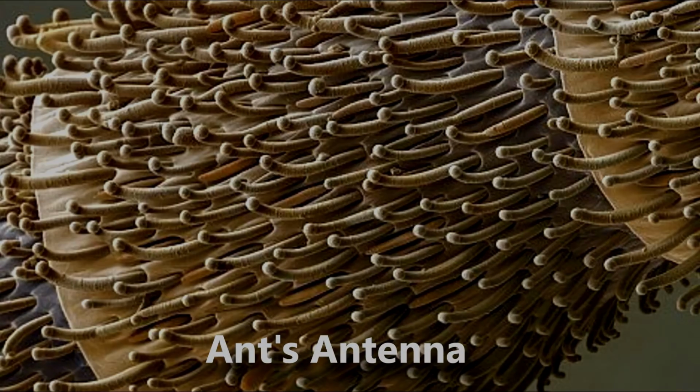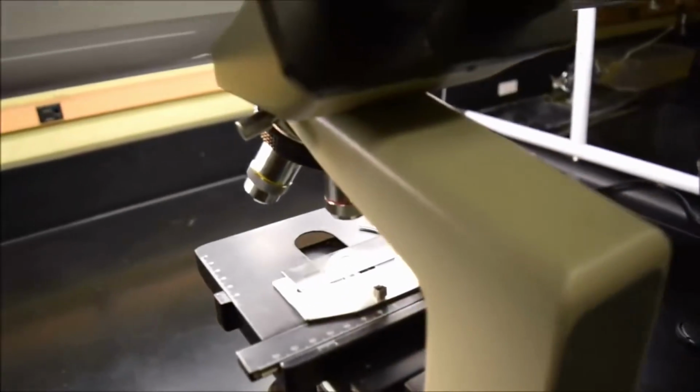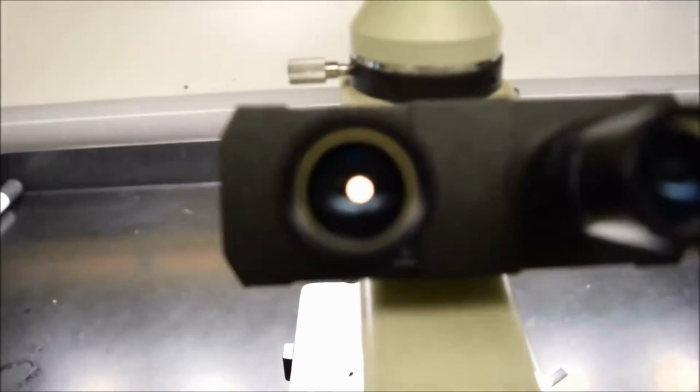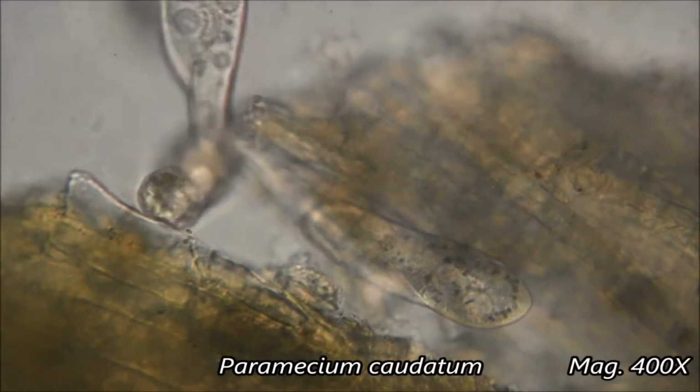People have been using the light microscope for a long time. Light microscopes are the normal microscopes we are accustomed to, the ones using the light emitted by the object, collecting the light beam, and showing us very fine objects. For example, it's very common in biology.